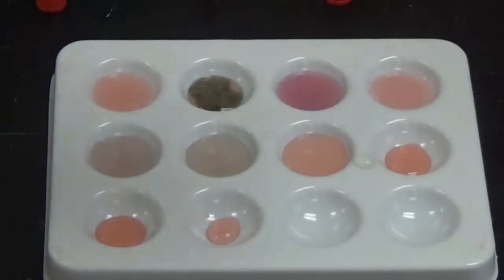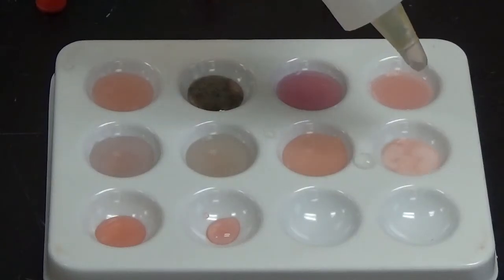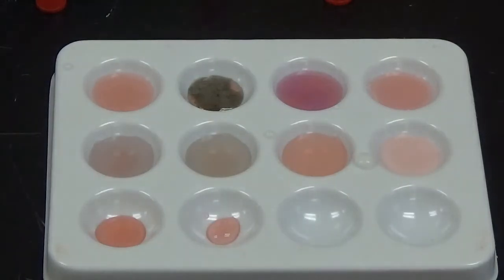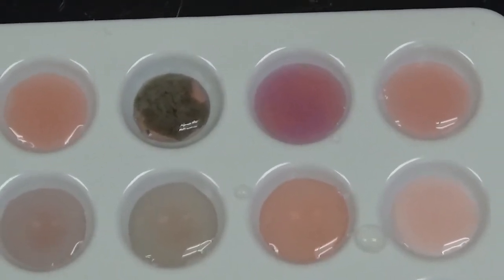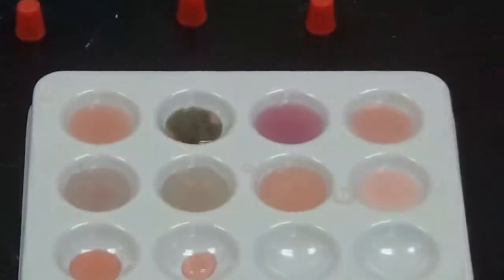So next up we add lead 2 nitrate to the last well in that second row. And you can see there where we have a nice bright white solid forming. Okay, we see a lightening of that color, and if we move in, you can most definitely see the signs of the white solid around the edges where it looks much brighter white than in the middle.